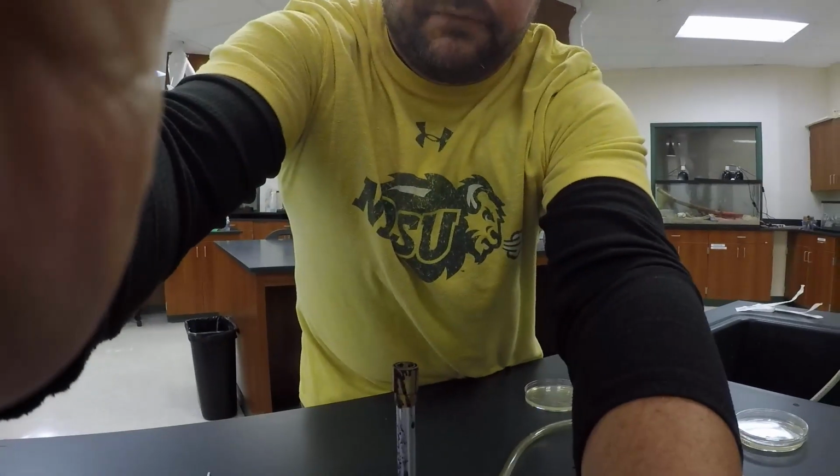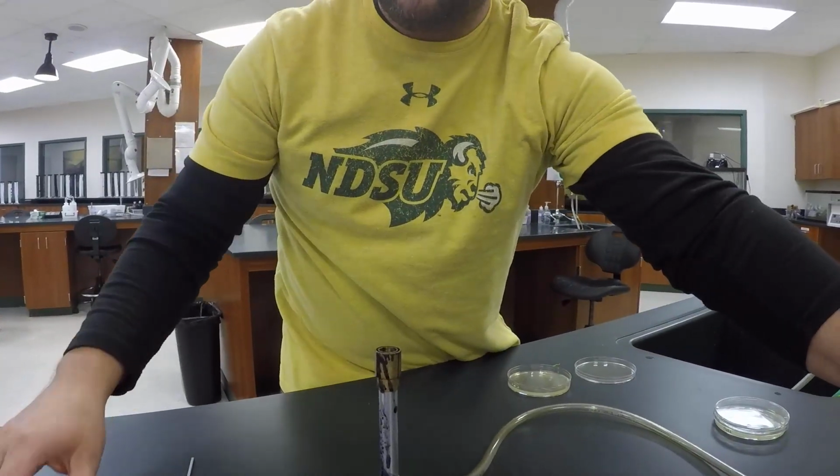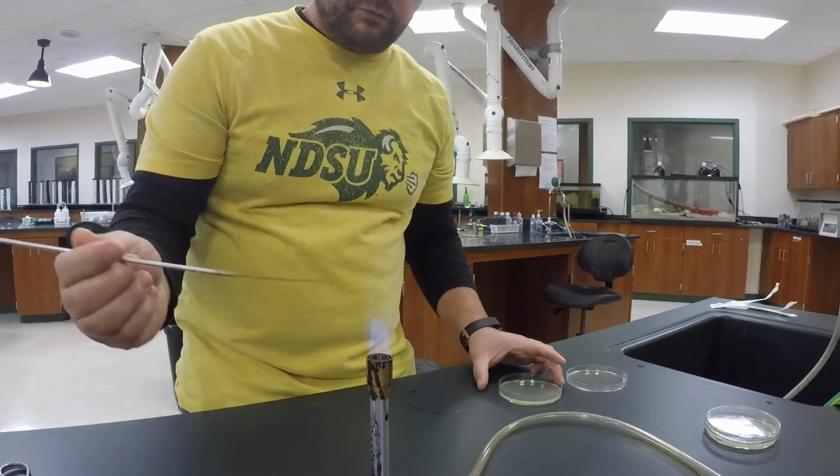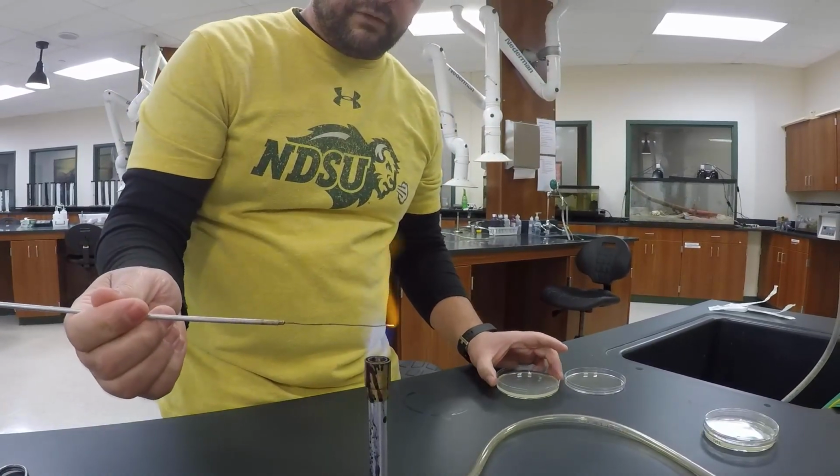Oh, that was not fun. I don't recommend doing that too often. Alright, so, got it. Now, again, I'm going to flame the loop and inoculate this material.